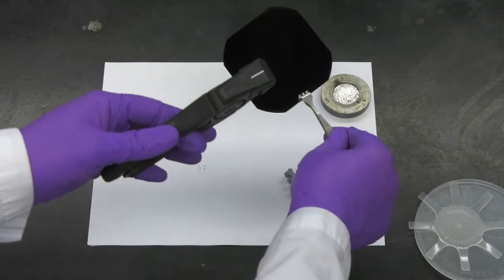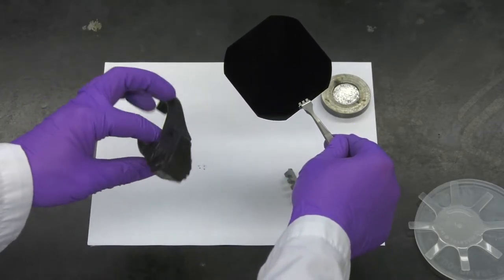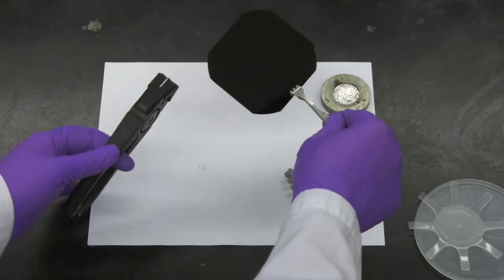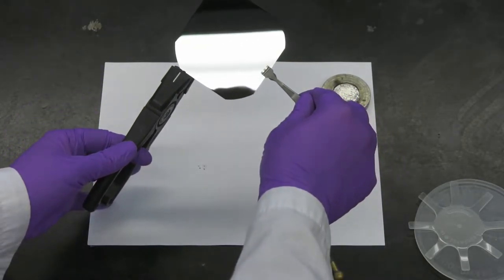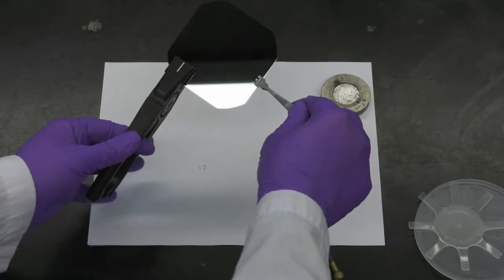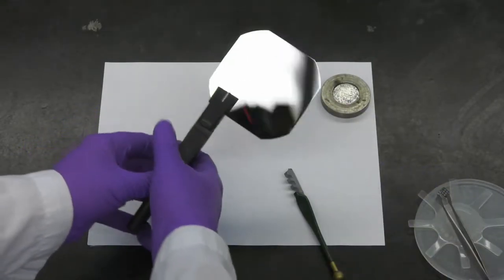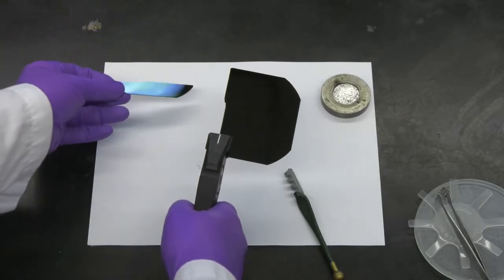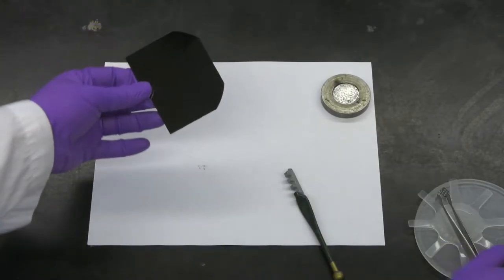Using a special tool to provide bending stress, the silicon wafer fractures along its preferred crystallographic direction. Based on how this wafer fractures, you should be able to guess the crystal orientation of this wafer and predict which diffraction peaks it will exhibit.